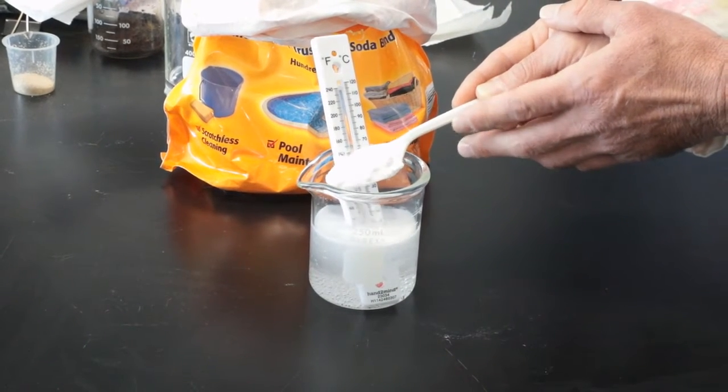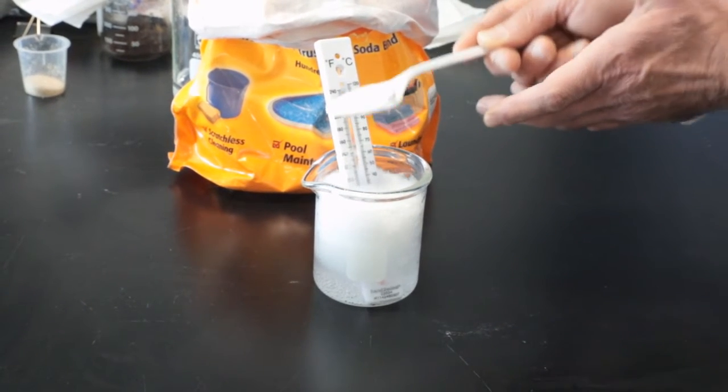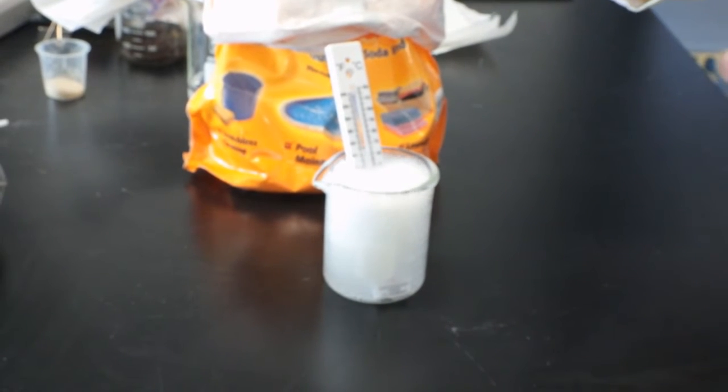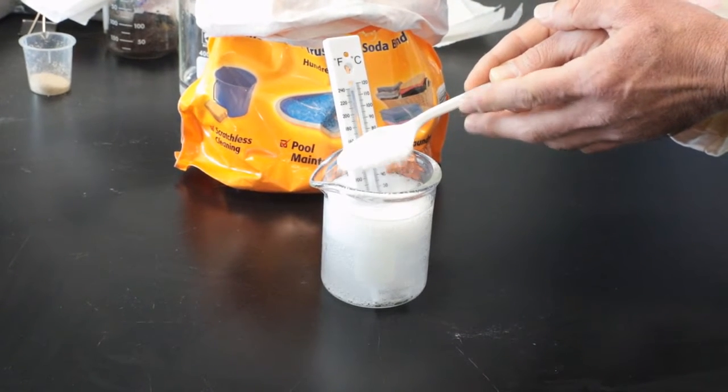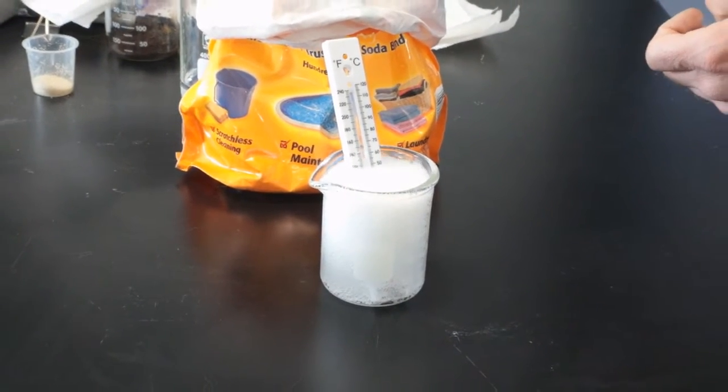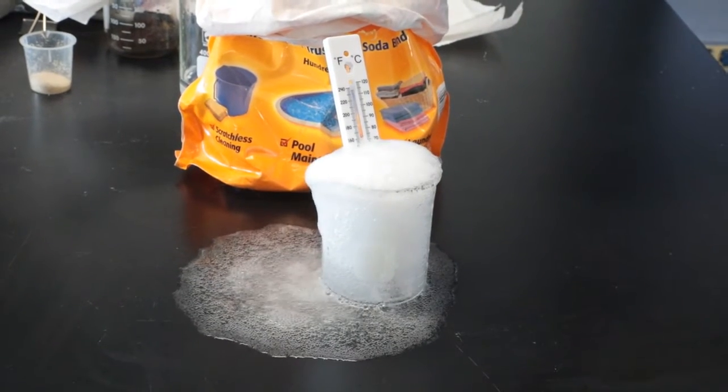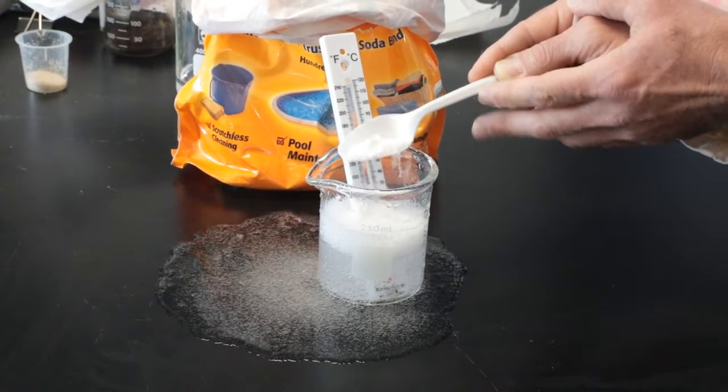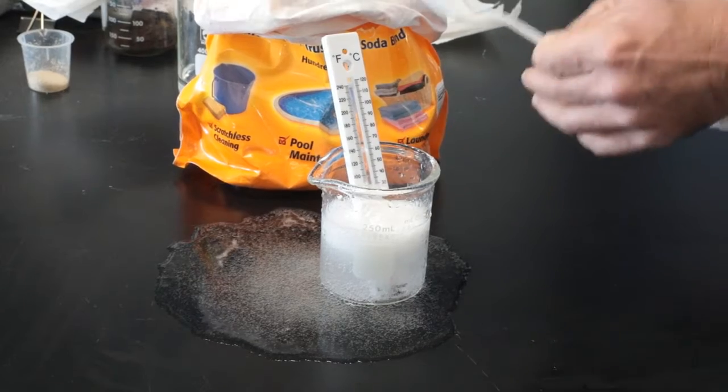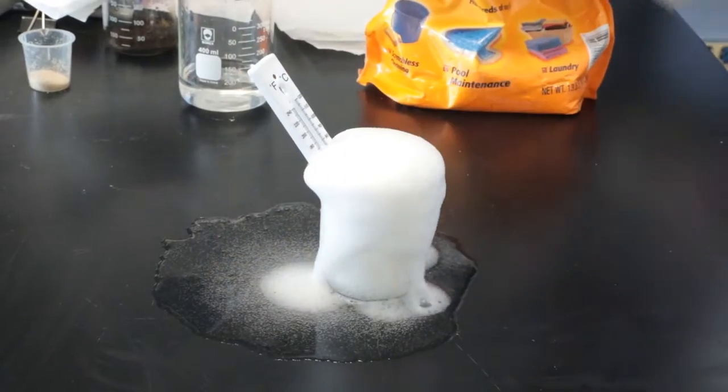Let's proceed. Initial temperature is 15 degrees Celsius. You notice he's cautiously adding a little bit at a time so we get the reaction but not too much carbon dioxide. We don't want a lot of carbon dioxide. We're getting some there. That keeps it under control. Dave's doing a really good job of controlling how much carbon dioxide we have so it doesn't make too big a mess. Well, so much for that. You know, this is a really good stain remover for carpets by the way. Add the rest of it.